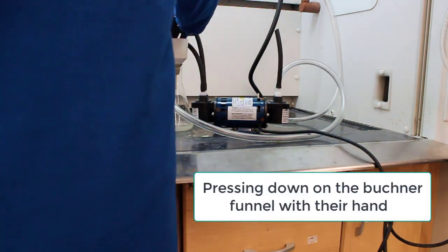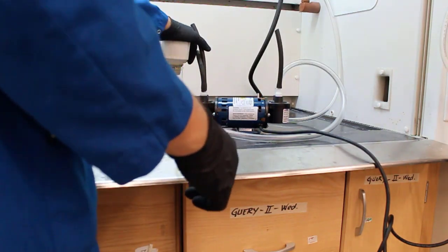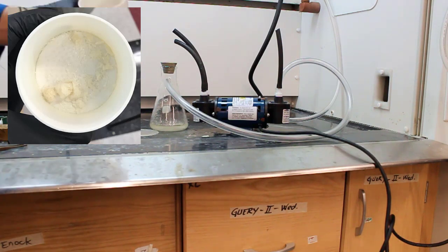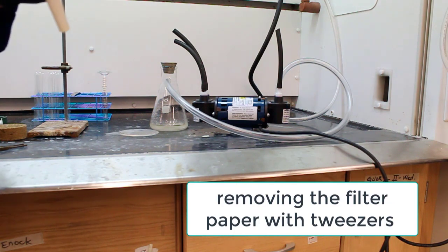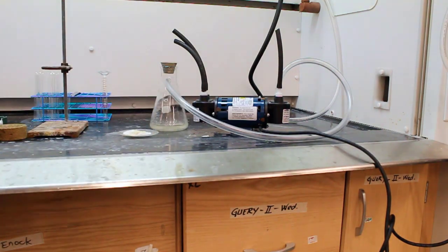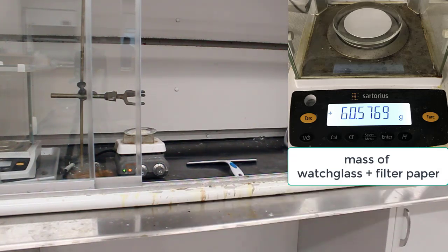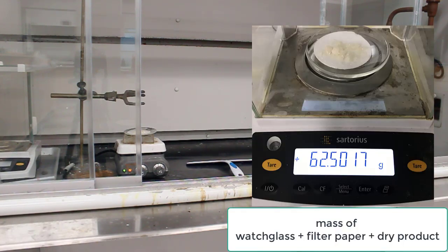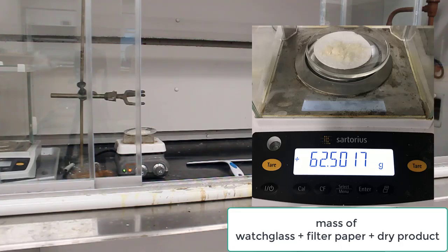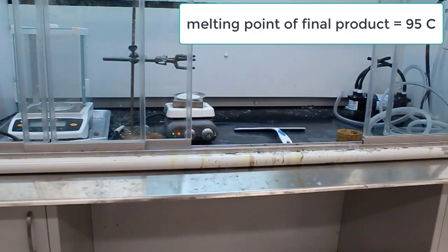Sometimes the seal's not great on our Büchner funnels and flasks, so I was applying a little pressure to help. You can see this is what the dry solid looks like — there's our product. I'm next going to remove that filter paper from the Büchner funnel. You're about to see the mass of our filter paper and watch glass — record that because we need to do a subtraction to figure out the product mass. Allow it to dry on the hot plate. Once dry, the mass shown is 62.5 grams — that's the mass of the watch glass, filter paper, and dry product combined, so subtract those two numbers to get the product mass. The melting point determination came to 95 degrees Celsius for our product — use that to determine how pure and if the reaction was successful. Good luck with your lab report.